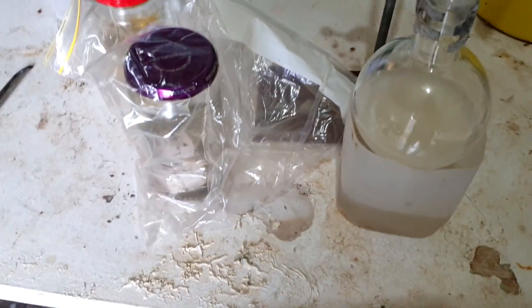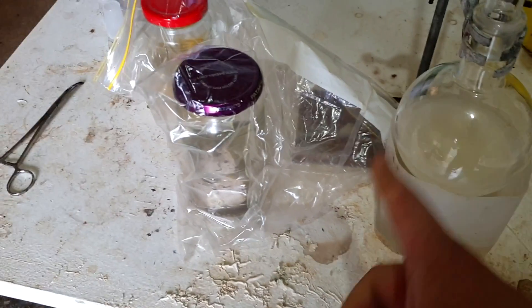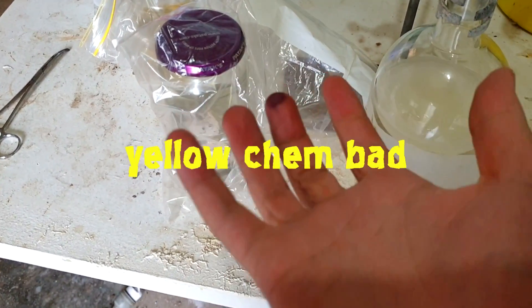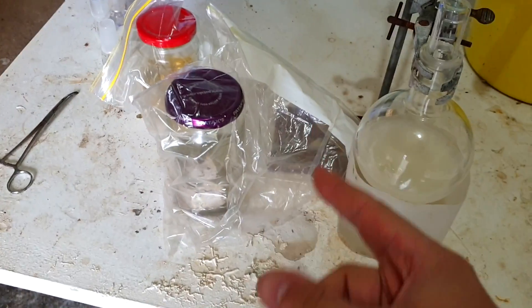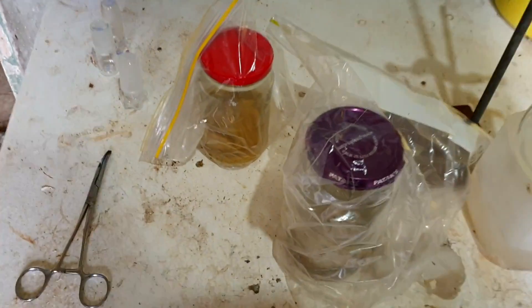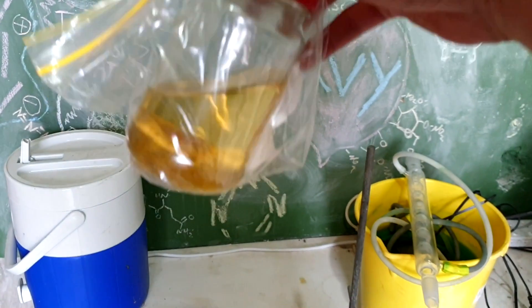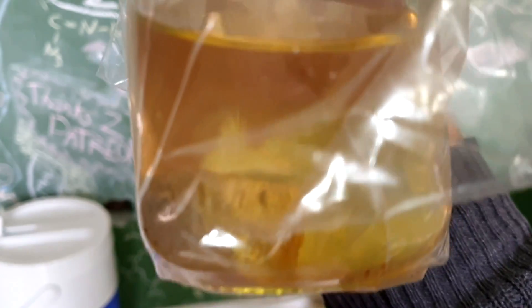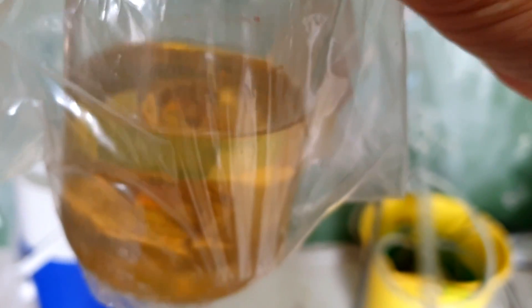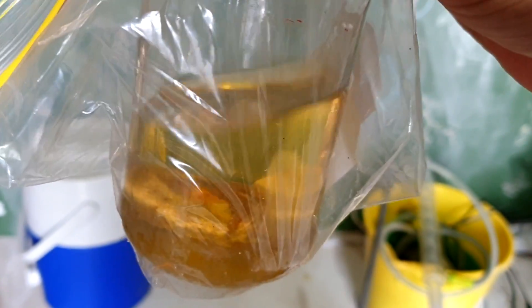So let's have a look at my sodium first. There's not a whole lot of it — that was a hundred grams initially and it looks like it's mostly there, so probably about 40 grams of sodium. You can see a quick glimpse of the potassium container on the back there. What you don't want is potassium going yellow. If your potassium is going yellow, it's a buildup of superoxides and that's dangerous because it tends to be explosive. I had a look at my potassium the other day — look how yellow everything is on it, look how yellow the mineral oil has gone. It's probably about 30 grams of potassium and it's in bad nick. It needs some maintenance — I need to chop off those oxides and dispose of them. So we might as well use some of that alkaline metal, once we chop off all those oxides, in drying our dioxane.